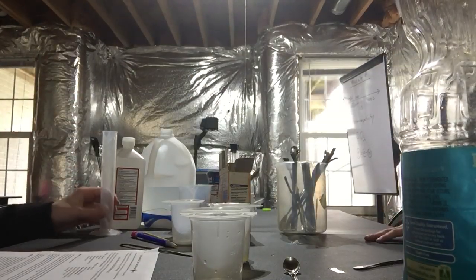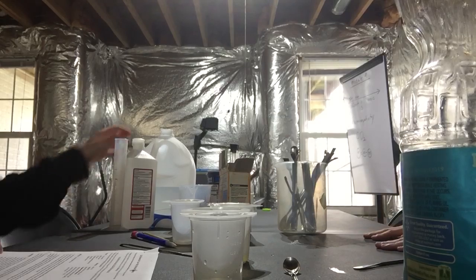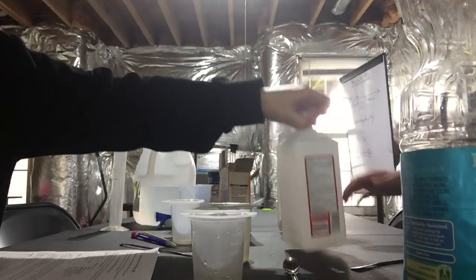Wait, now you're going to do the isopropyl alcohol. Can you trust me with that? I did the last time. I'm not 21, am I?